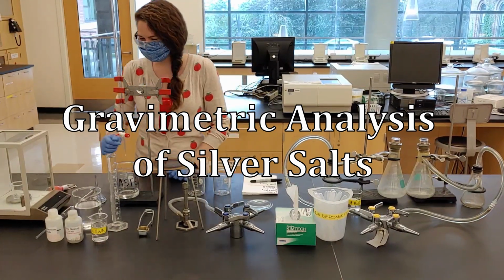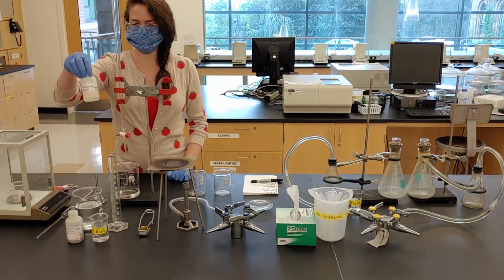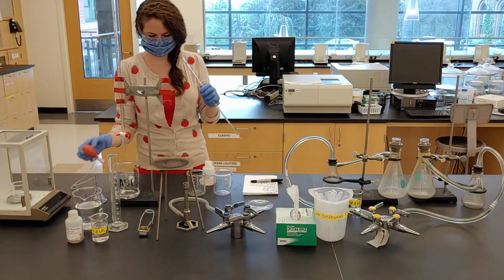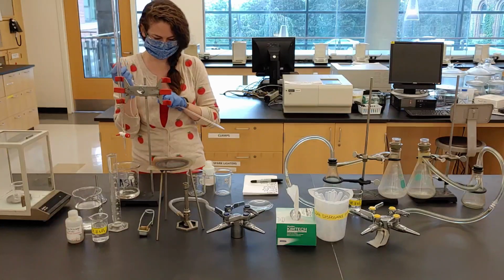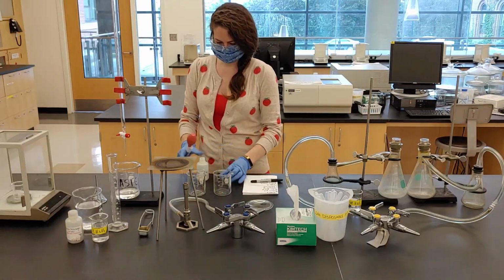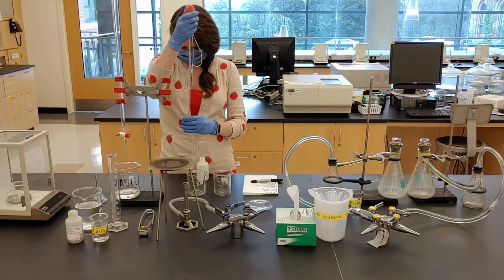In this lab, we will investigate the relationship between reactants and product. Our first reactant is potassium chloride, which we will pipette 25 milliliters of into each of 2 beakers.